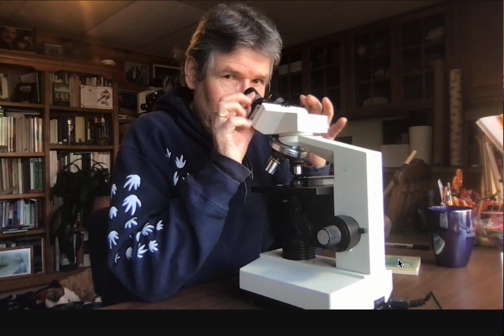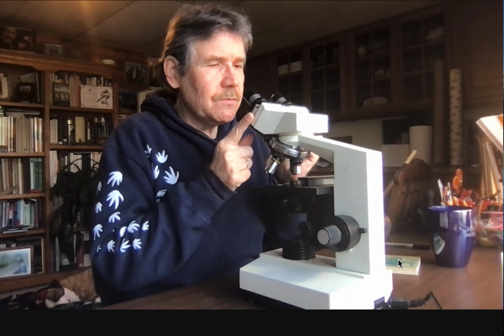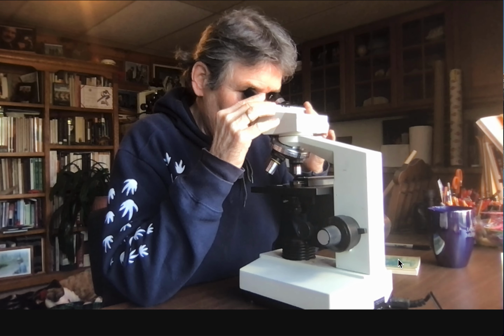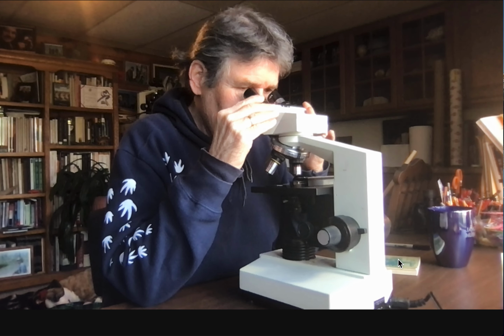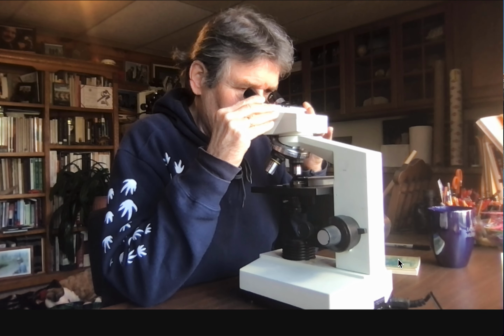These eyepieces are adjustable. And it's kind of neat, paid extra for this. But when you move one sort of towards the middle, the other equally comes in. So it's nice and balanced on the center. And what you want to do is not have your eyes just pressed against the scope, but actually be back just a little bit and see if you can do these so that you get one good clear image.